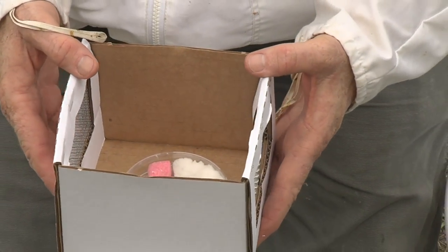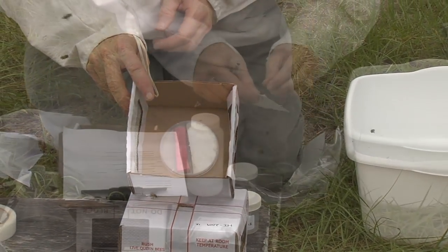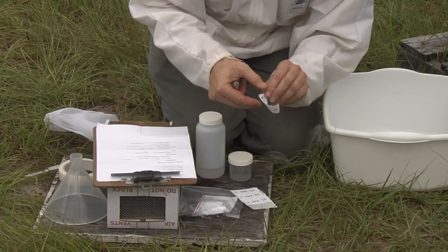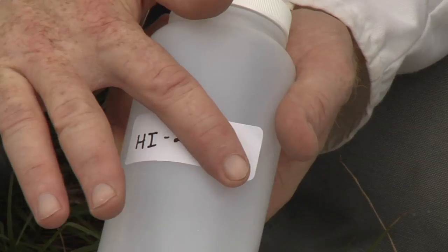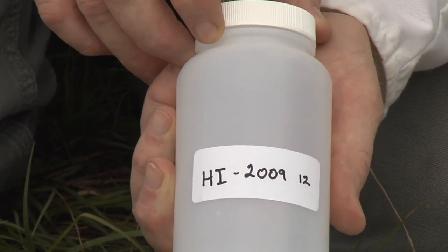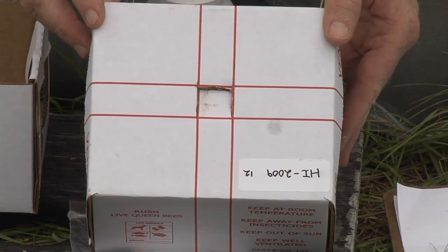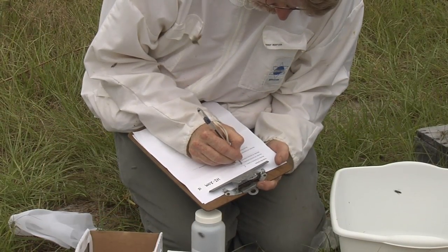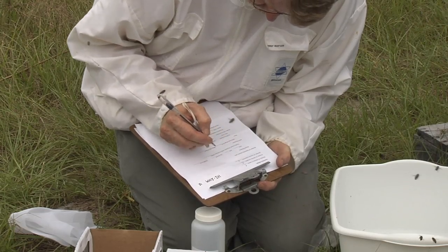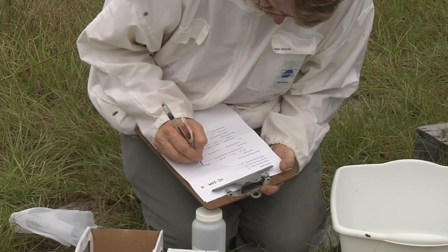You will find a petri dish glued to the bottom of the box that contains queen candy and a sponge. Next, place one ID sticker onto the data identification sheet, another on the large collection bottle containing alcohol, one on the small collection bottle containing alcohol, and place the final ID sticker onto the live bee shipping box. Fill out the data information sheet, which includes the beekeeper's contact information, apiary location, and date of data sample collection.